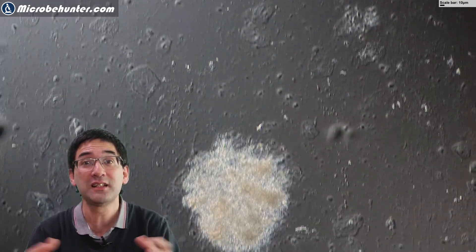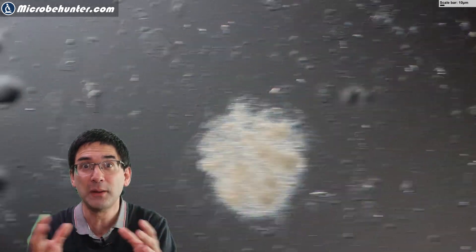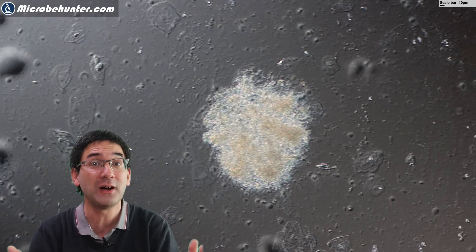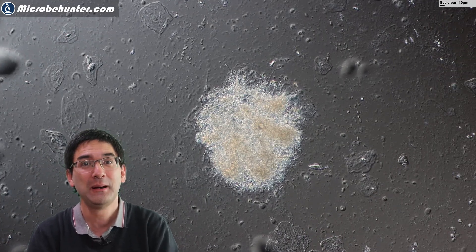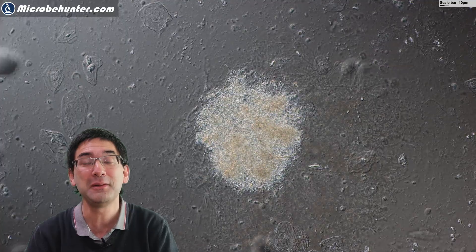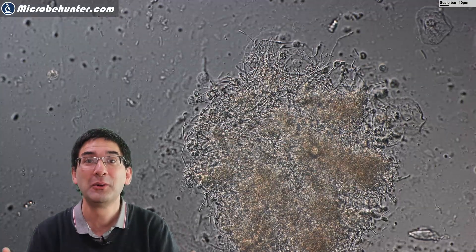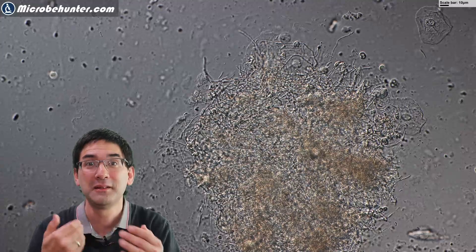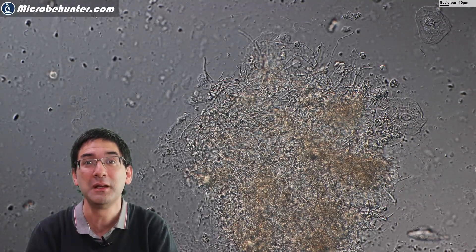I've also seen some other interesting things, like this strange ball of what appears to be fibers. I don't know what that is, but it does not surprise me, because whatever you inhale will essentially end up being glued into the mucus layer of your respiratory system.